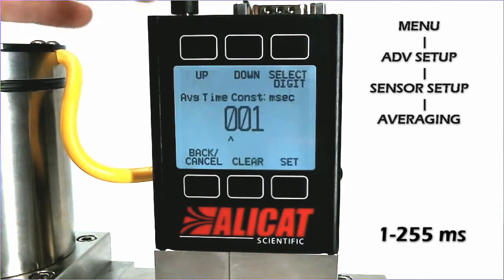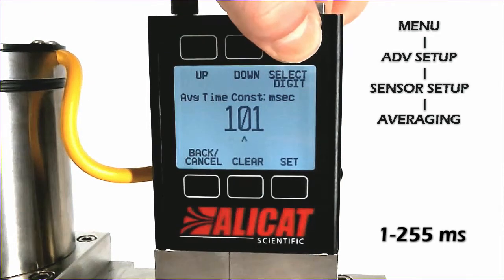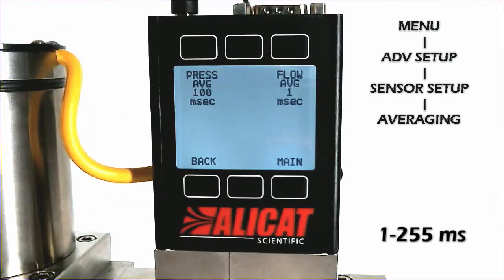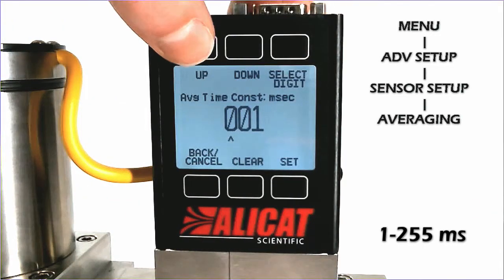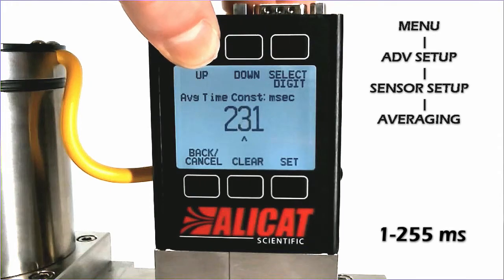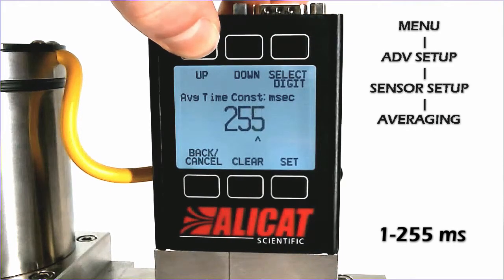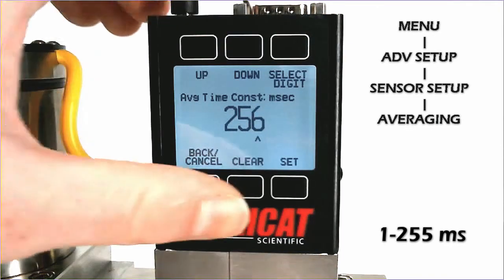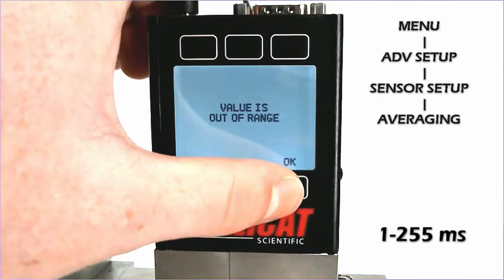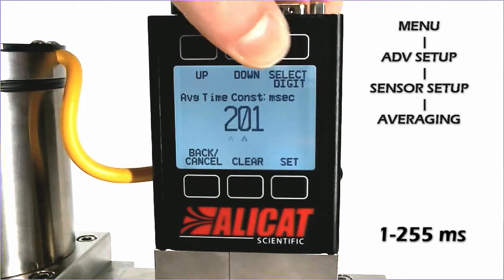We can change our pressure averaging to 100, and our flow averaging to the maximum of 255. Just as an example, I will send it 256 and the device should come back with an error. And yes it does — the value is out of range — so we will change that to 255.